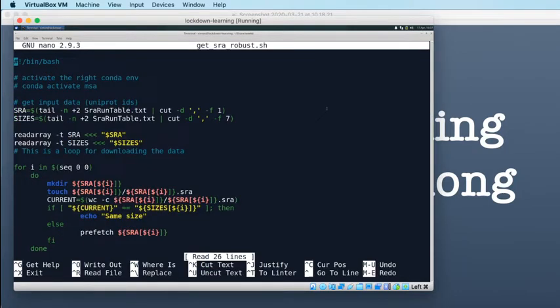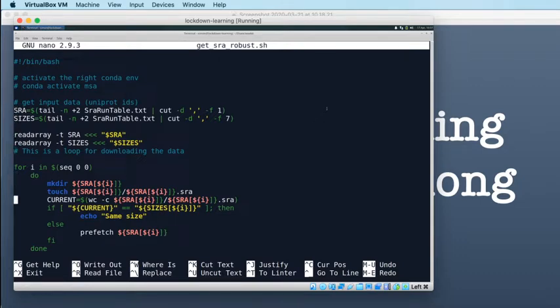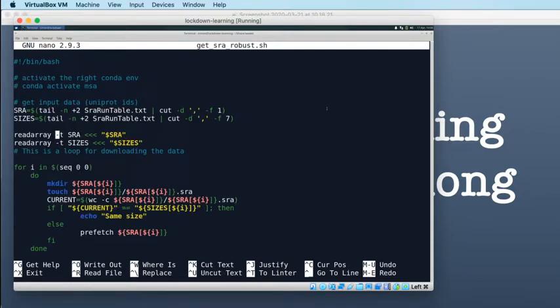So if we look at the script that I was writing yesterday, you'll see that it was getting quite complicated, and I didn't really want to expose people too much to this script because it's a little bit of a mess. I would have tidied it up if I'd needed to, but actually I did discover that Prefetch does this for us. So I honestly don't think that we need to do too much stuff here. So I think what we should do is rely on Prefetch doing it correctly, and if Prefetch completes successfully, then we can assume that it's worked.